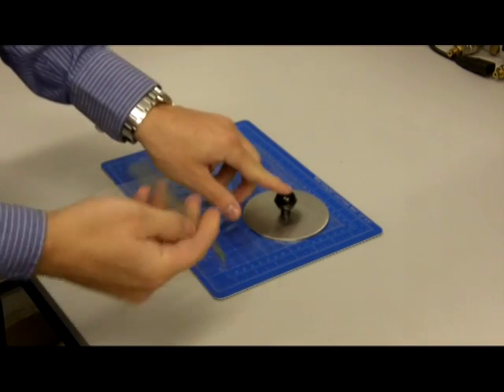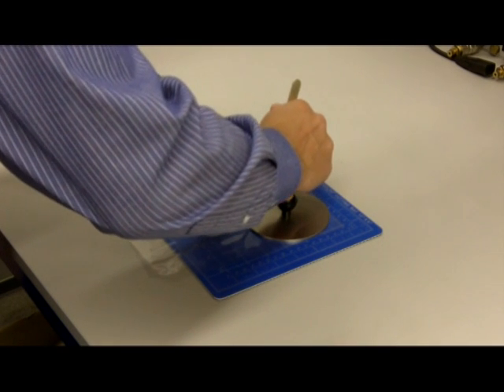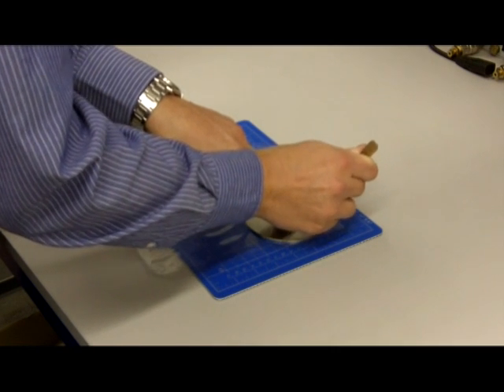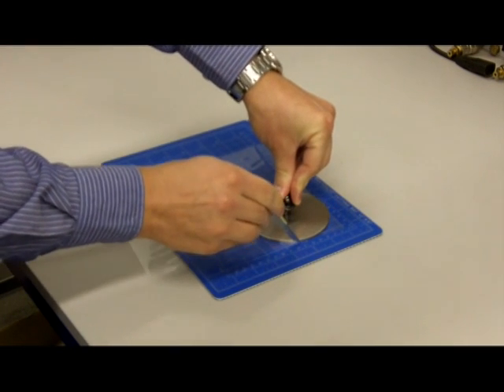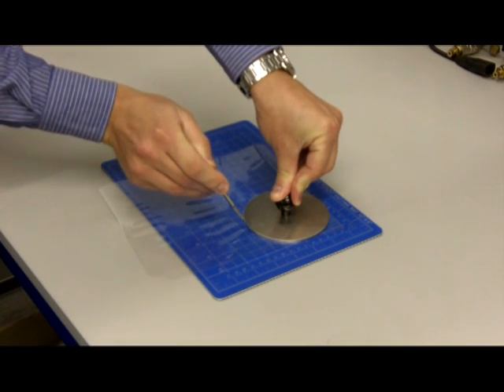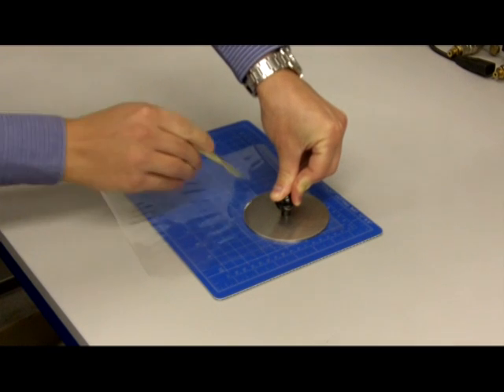So now let's cut a sample of film ready for testing. Using a template and scalpel you cut out the film with tabs either side for handling. As you can see it's a very straightforward and simple process.